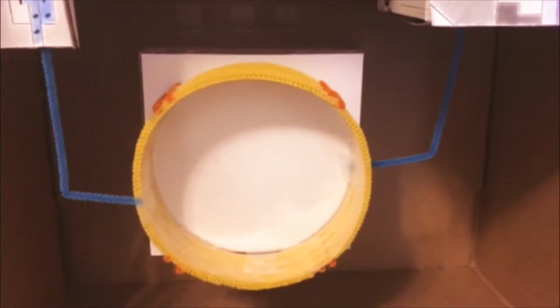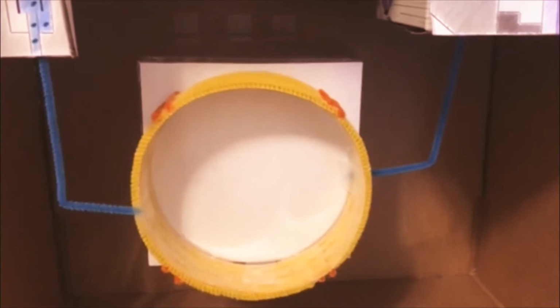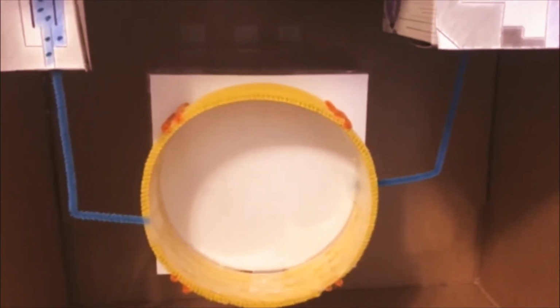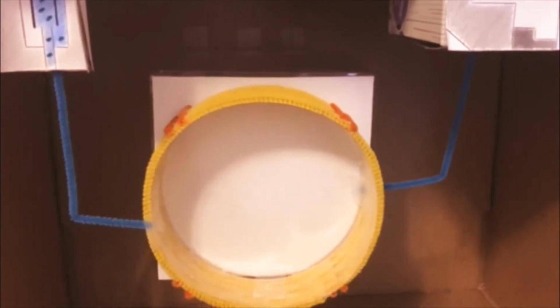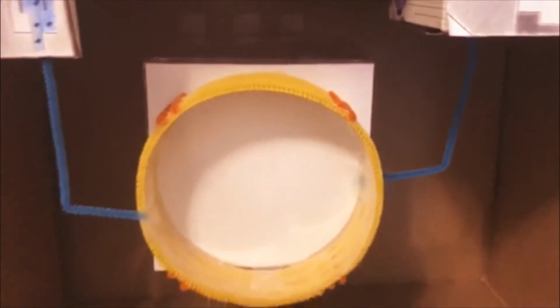Next is the column. The column is contained in an oven and is held at an elevated temperature, which maintains the sample in the gas phase as it goes through the column. Here the separation is occurring in this equilibrium between the gas phase and the stationary phase. The stationary phase is the very long capillary tube that is coiled in a ring.